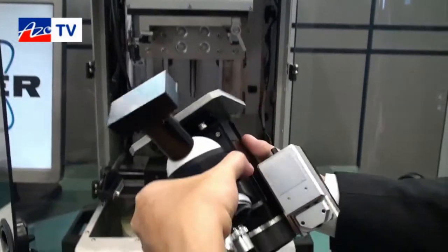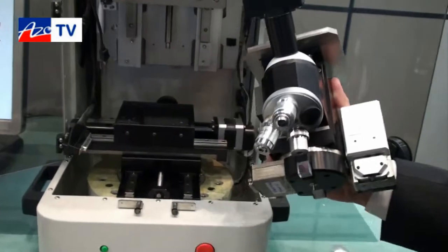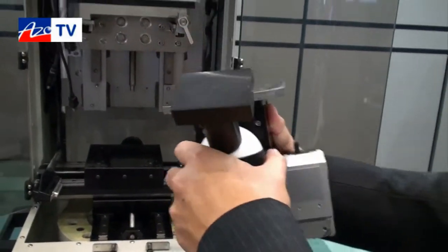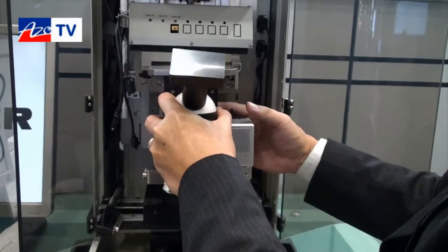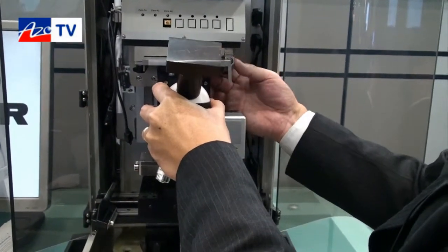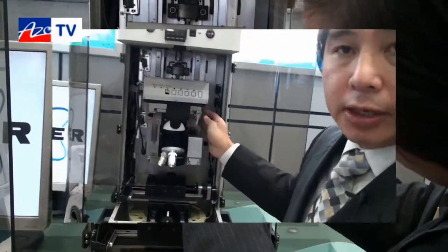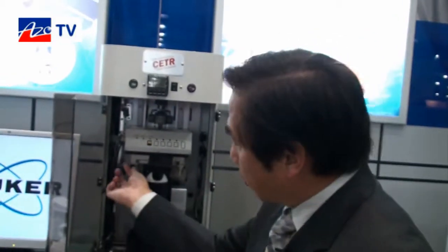We can then put a similar unit in for micro indentation. As I mentioned, for nano the load range is up to 500 millinewtons, and for micro indentation it can go all the way up to two newtons.